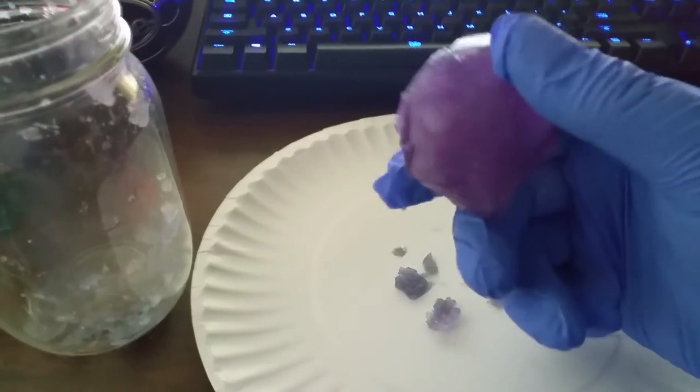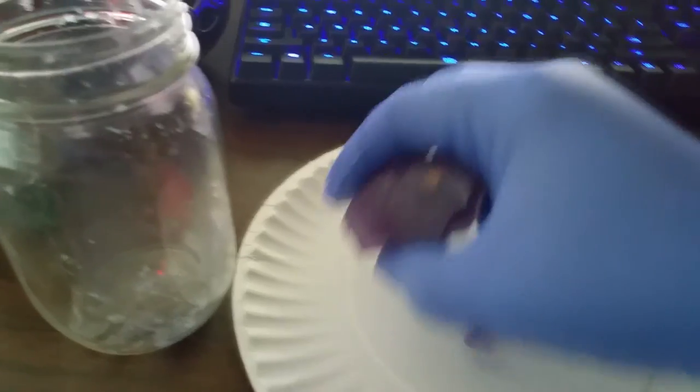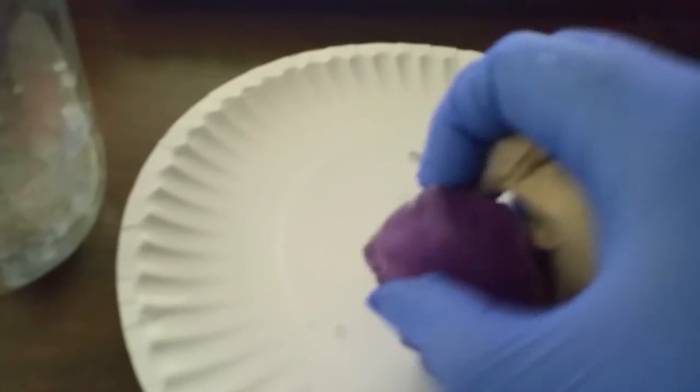What I'm doing now is adding clear nail polish to this crystal — it won't react with the chemical inside and it will keep water from touching it. Now because I have such a large crystalline mass I just dumped it onto the crystal, but this is not advisable on small crystals as every bit of nail polish you add actually destroys the outside of the crystal. What I recommend when varnishing your crystal surface is to perform one light coat on the surface and a secondary coat to ensure that you get the entire surface of the crystal. Any exposed surface will degrade over time.